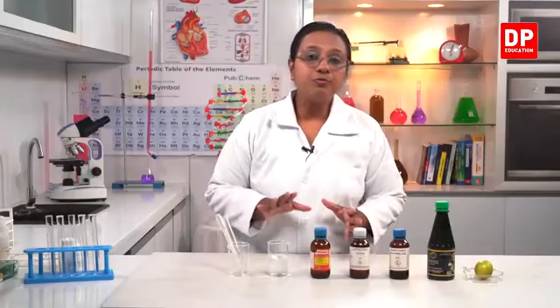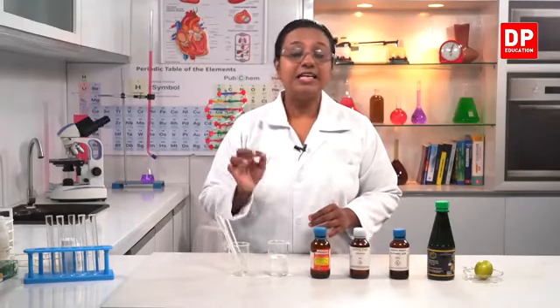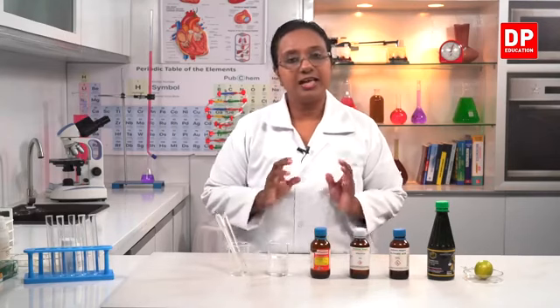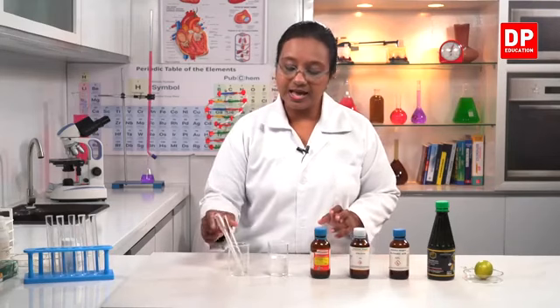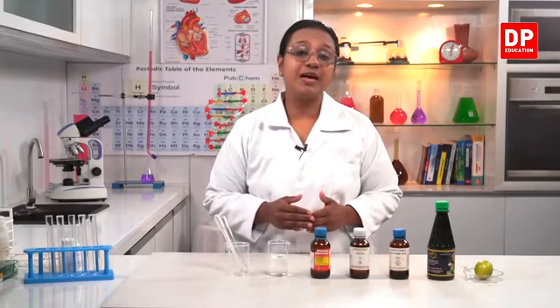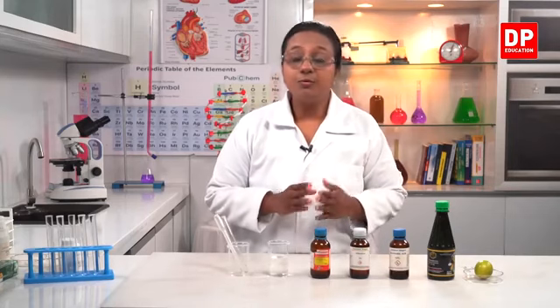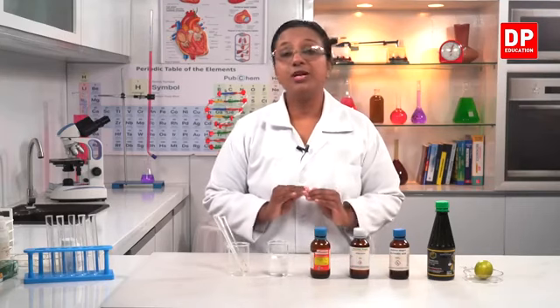We never pour the water into acid, but instead we have to add the acid little by little into a large container containing water. Here I have taken only a small amount because the acid is only a small amount. But when you are diluting large quantities or large volume of acid, then you will need to use a large container with more volume of water. So that is the acid dilution process. You have to remember that.